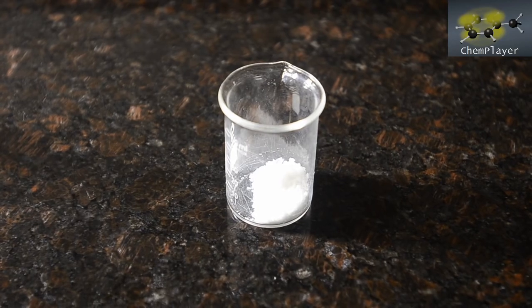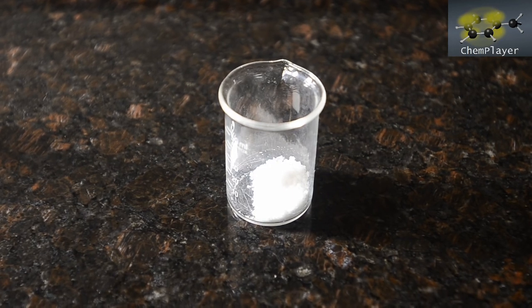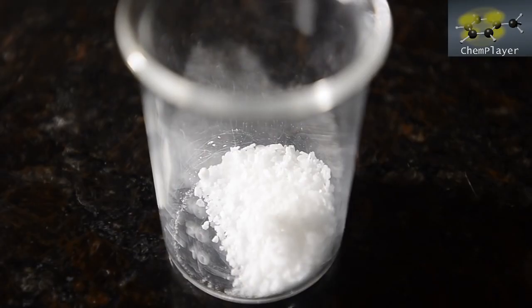Paracetamol is pretty cheap and commonly available, so we'll perhaps also try and see if it can be hydrolyzed using dilute acid as well as alkali at some point in the future to see if this is also a cleaner method.